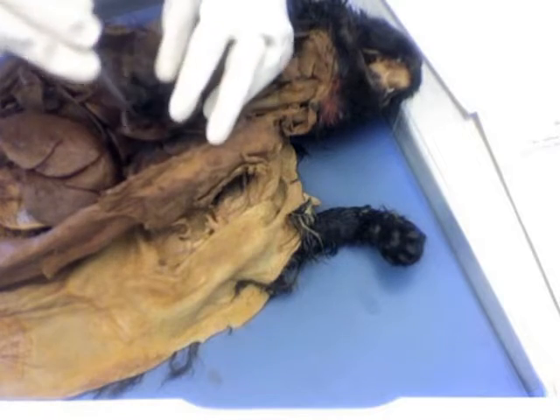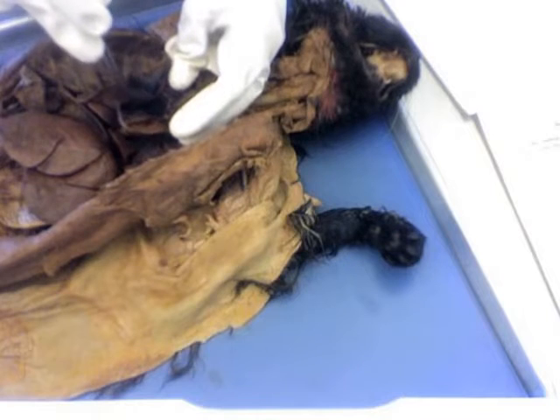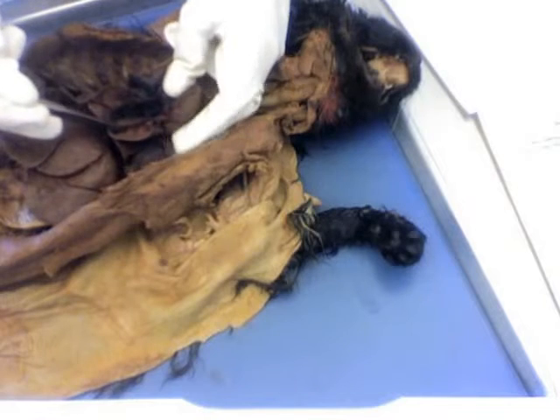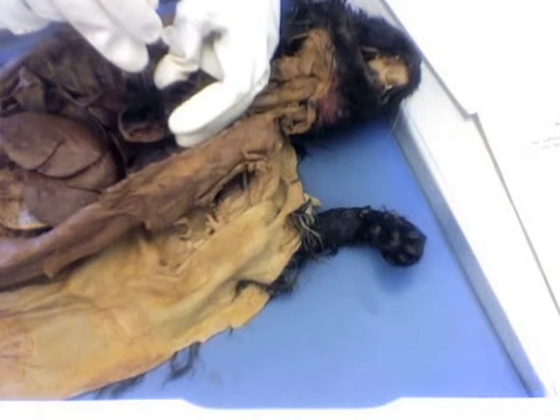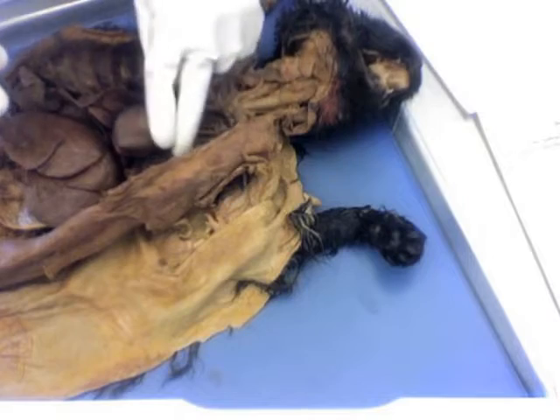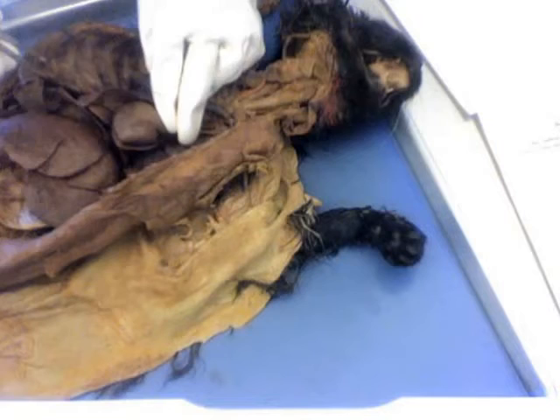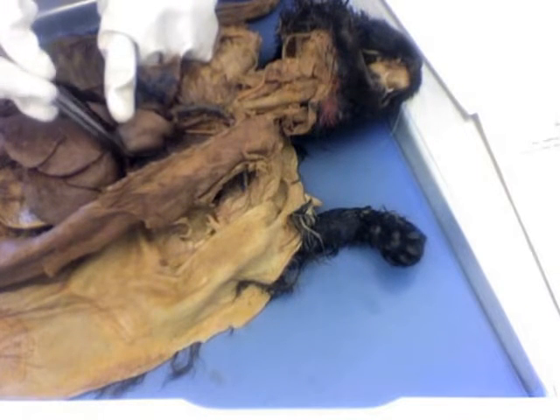So if we pop open the heart, just take a quick look. Again, this would be our right ventricle, left ventricle, left atrium at the very top, and right atrium at the very top there. If you imagine the heart like an upside down mountain, that being the point, and that is the base of the mountain, this is in fact the base of the heart, and then where it comes to a point there, that's called the apex.